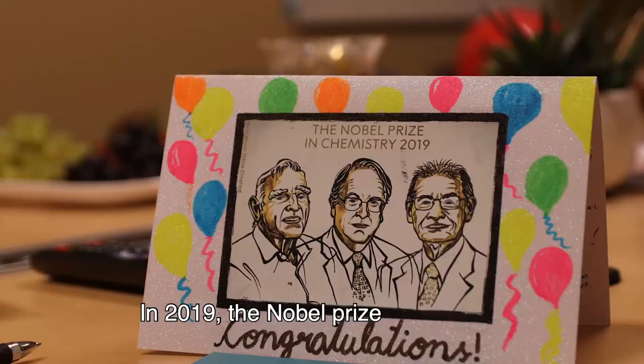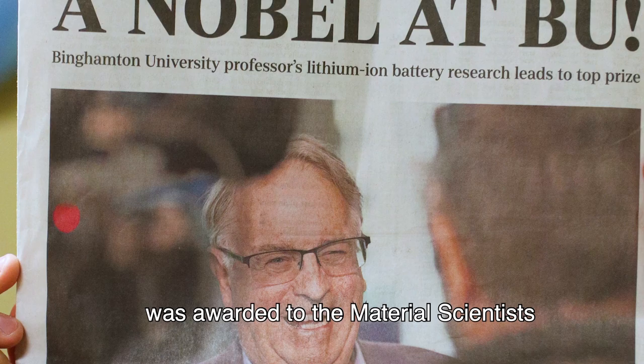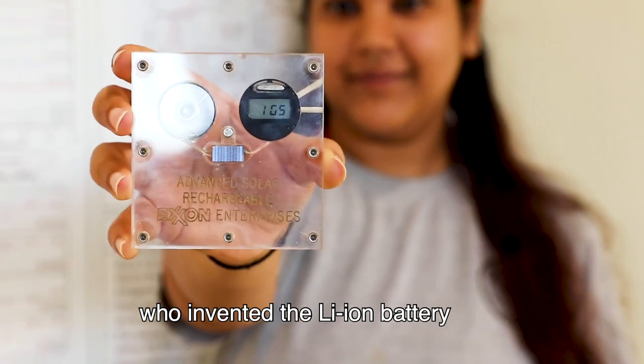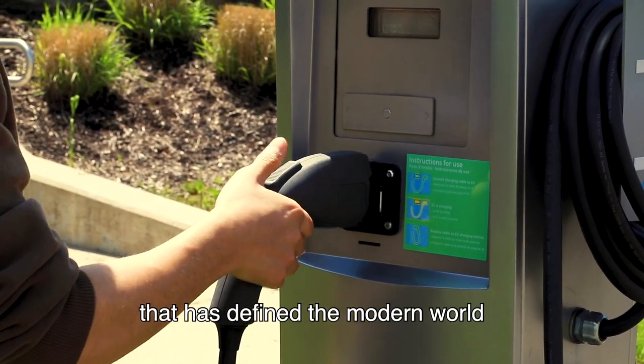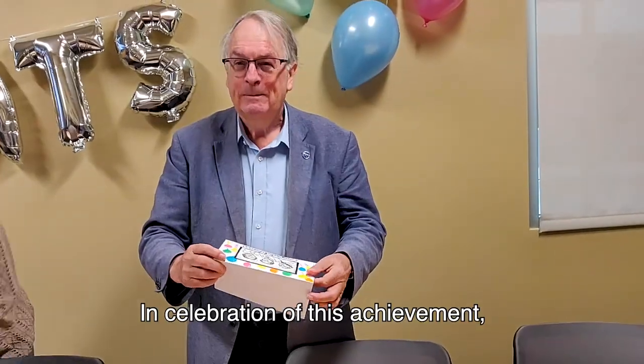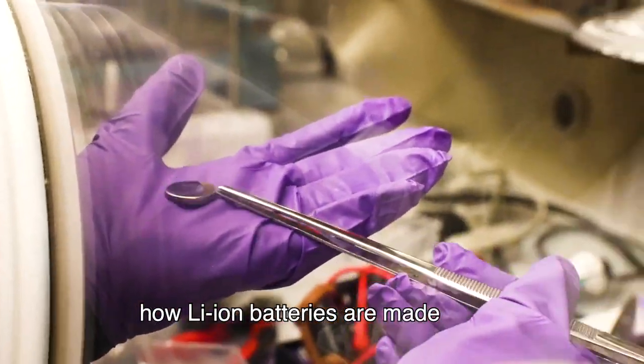In 2019, the Nobel Prize in Chemistry was awarded to the material scientists who invented the lithium-ion battery, a piece of technology that has defined the modern world. In celebration of this achievement, we would like to show you how lithium-ion batteries are made.